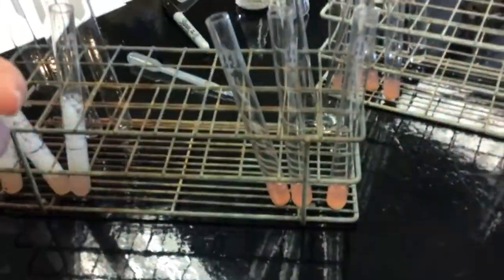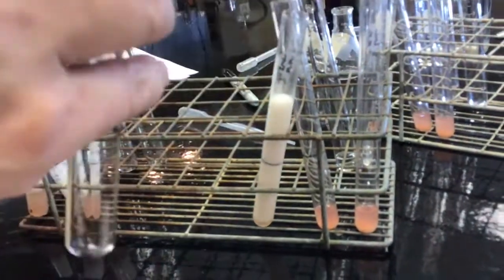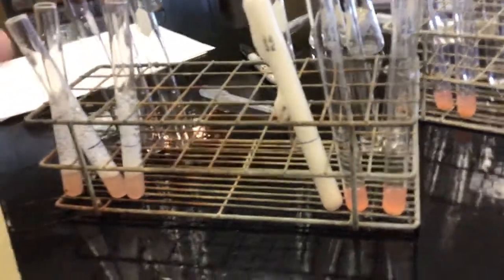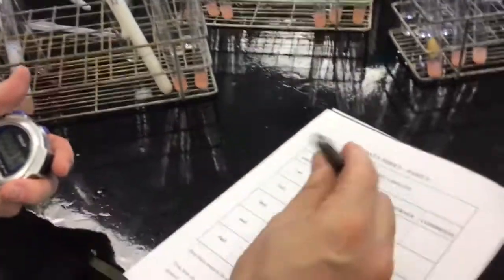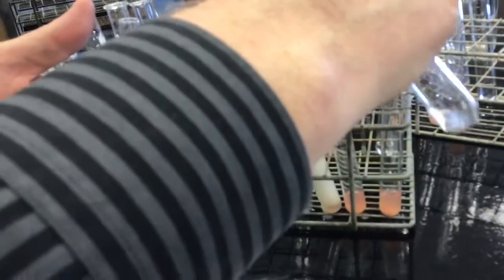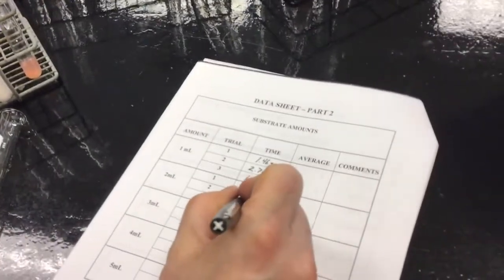These are 2 milliliter things of solution. Oh, trial 1. Whoa, that's fast. Up and out. That was 1.06 seconds. Trial 2. I need to get it so I can see the line. Got to zero it. That was quick. That was 0.61 seconds.